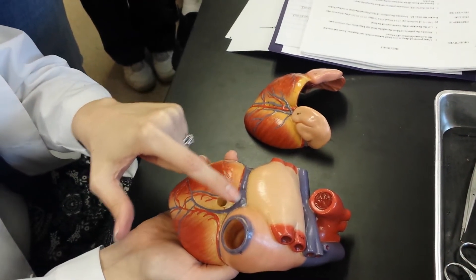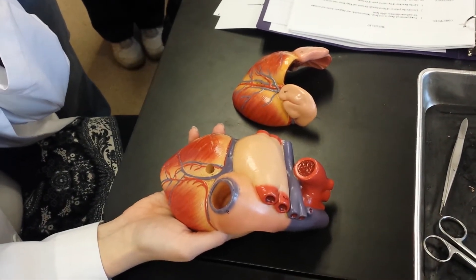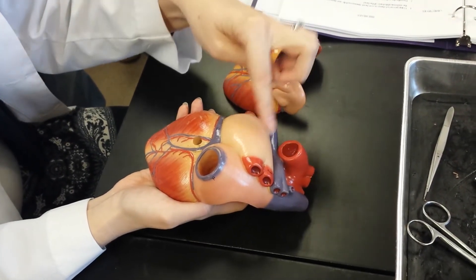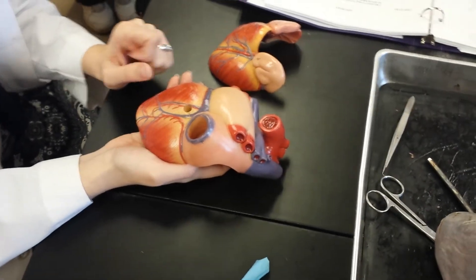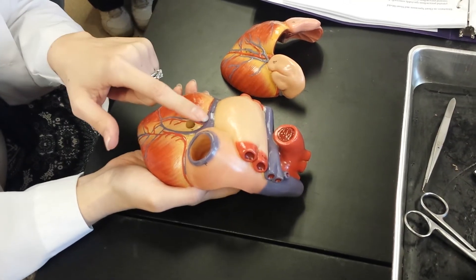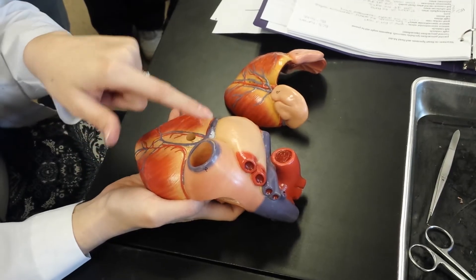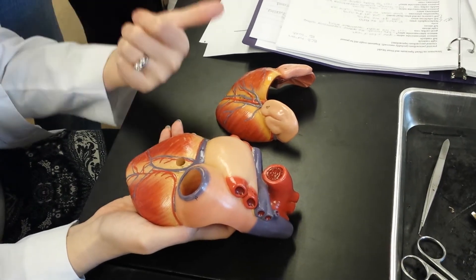What's that? That's a big vein called the coronary sinus. That's your coronary sinus — see how it's on the back of the heart? It's the only place you're really going to see it, and all the openings for your vessels would be in here. It's blue, so it's a vein. Coronary sinus is a special name for a really big vein like that. What's going to happen is the middle cardiac vein is going to drain blood off of the heart myocardium and into the coronary sinus, and this is going to return that blood to the right atrium along with the superior and inferior vena cava.